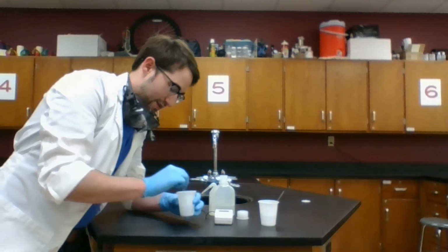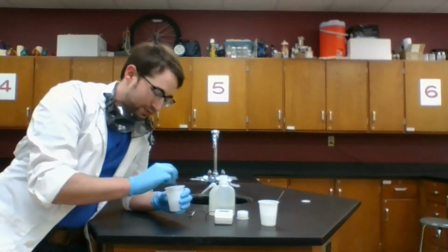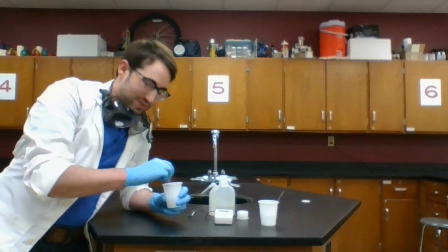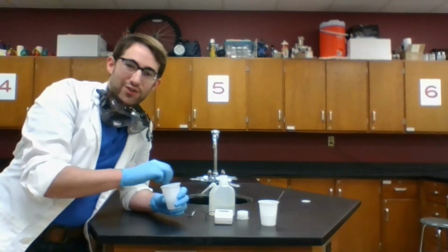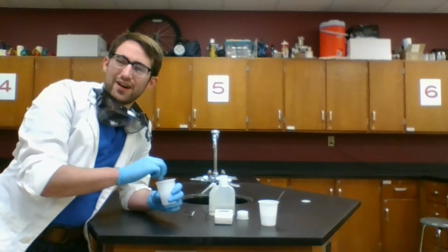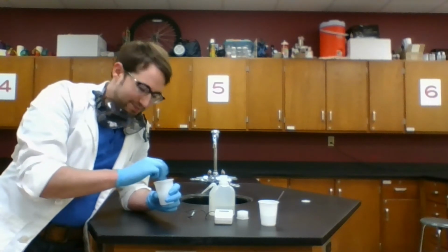Now, as I mix up my calcium chloride in the water, I dissolve it so it starts to break into smaller and smaller pieces, which means that it gets lost in there. You think about dissolving salt in water, sometimes you stir it up and it just vanishes, like it's gone. But it's not really gone, it's still in there. Mixing and dissolving are physical processes.